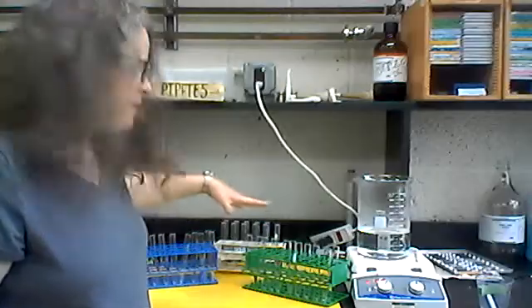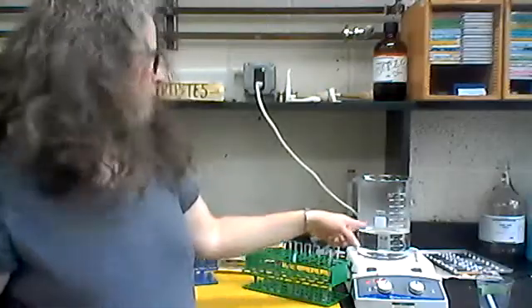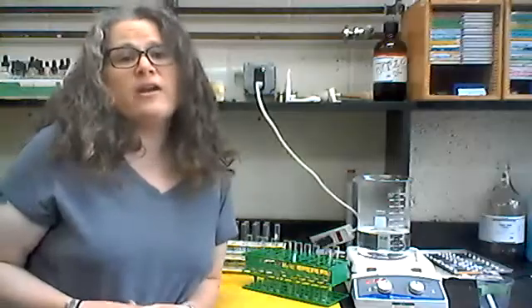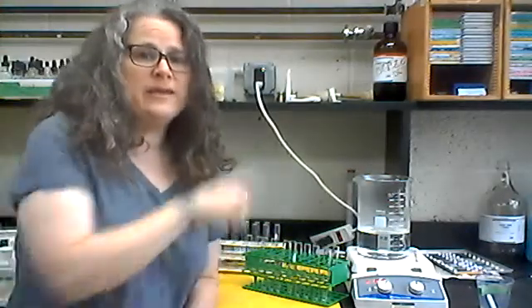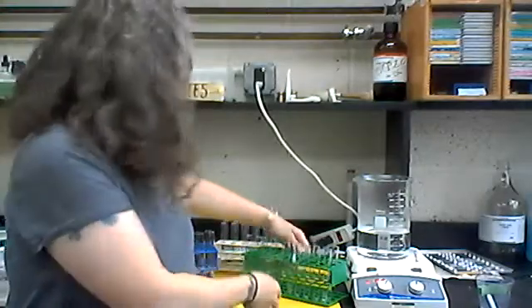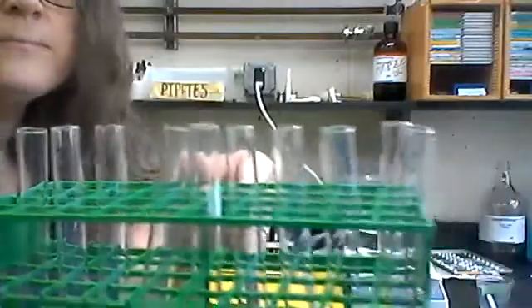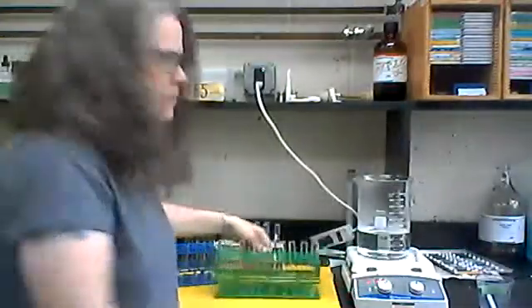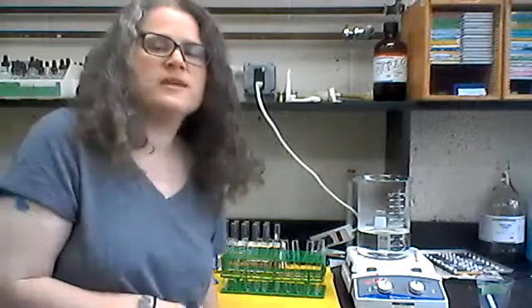So I have three different racks with a test tube set up. I have a hot water bath working here on our hot plate. I'm going to start off by putting one milliliter of each of those carbohydrates into a test tube. I've labeled each of these one through eleven. You can kind of see them there. So I'm just going to go through and put those carbohydrates into each of those test tubes, and I'll come back and show you what it looks like.